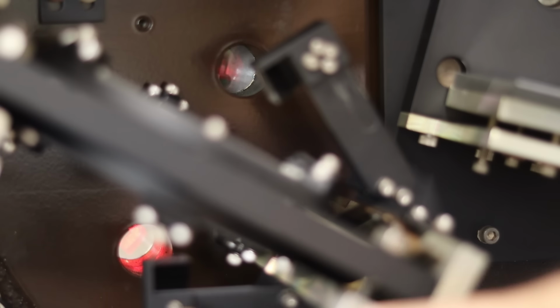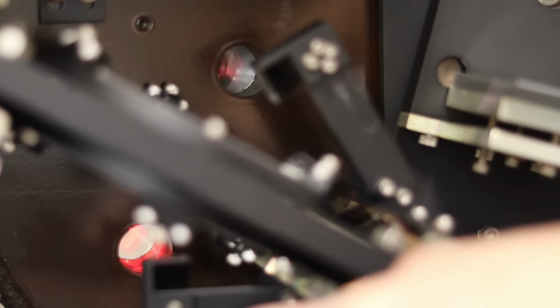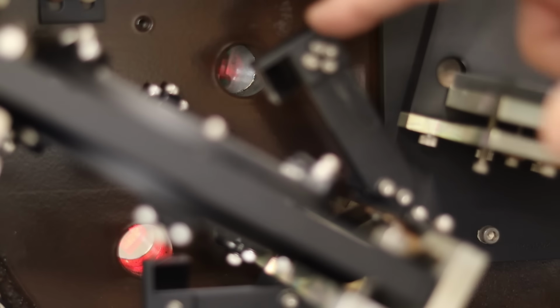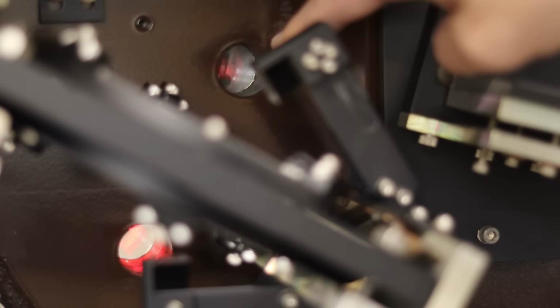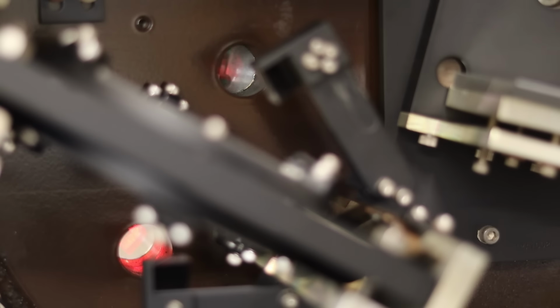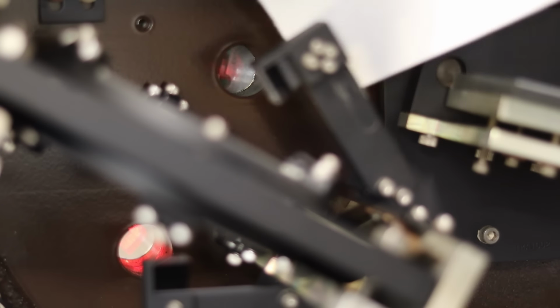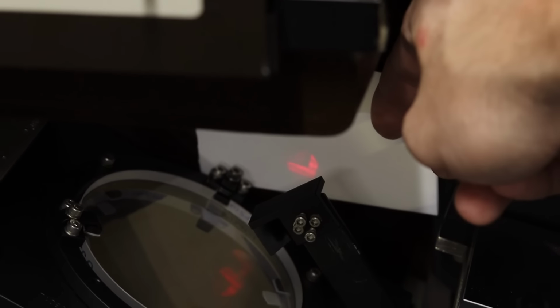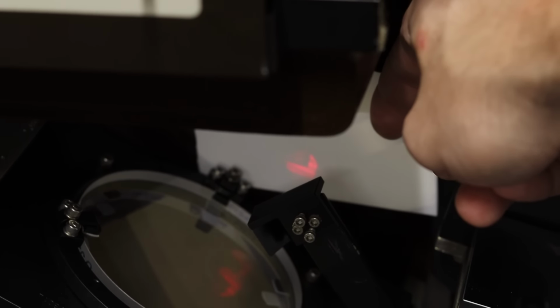The laser comes out of this little port right here on the bottom, and it hits this mirror right here that sends it through the full optical path. Hits this mirror and heads back through this little port up here to a sensor. And actually, if I hold a little piece of paper here, you can see what the laser looks like. That's what the laser is supposed to look like. It is going through the port, so the laser itself is aligned, but the detector is not.